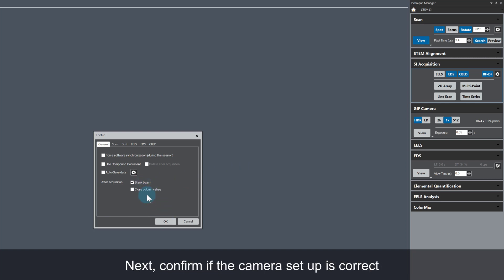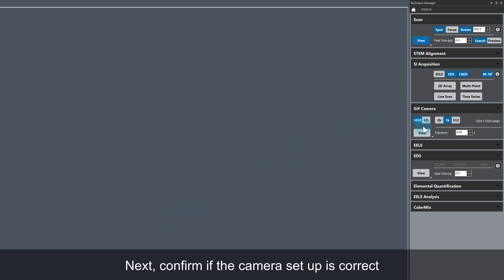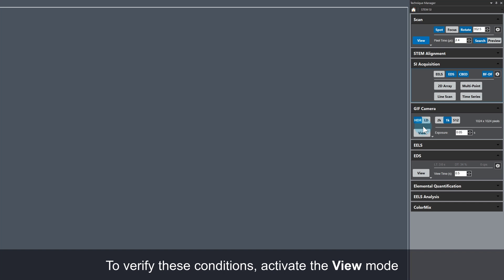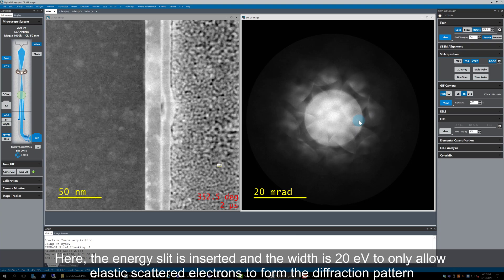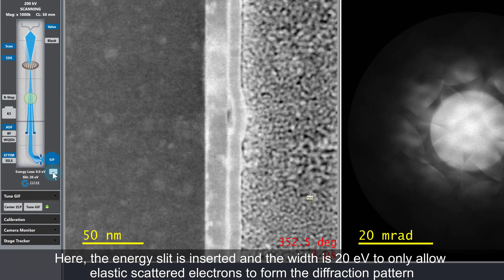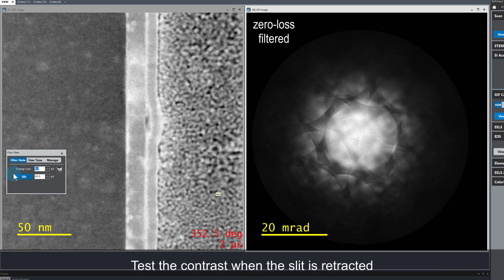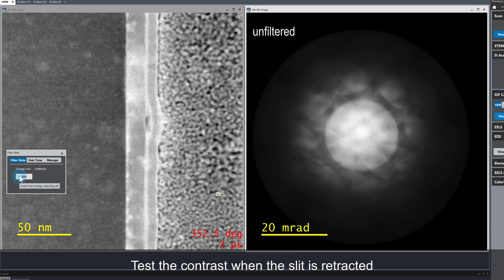Next, check the camera setup. I'm currently using the camera in HDR mode with 2x binning. To verify if these conditions are good for an experiment, just start a live camera view. At the moment the energy selecting slit is inserted and the width is 20 eV. By allowing only elastically scattered electrons to pass beyond the slit and form the diffraction pattern image, the contrast is improved. Look at how the image contrast is reduced when the slit is retracted.